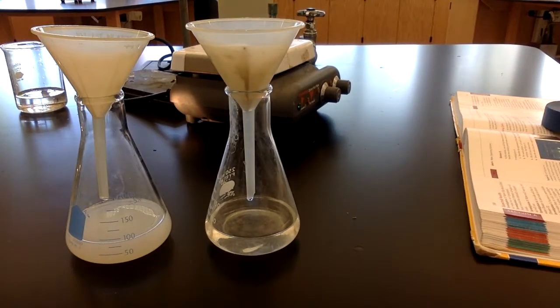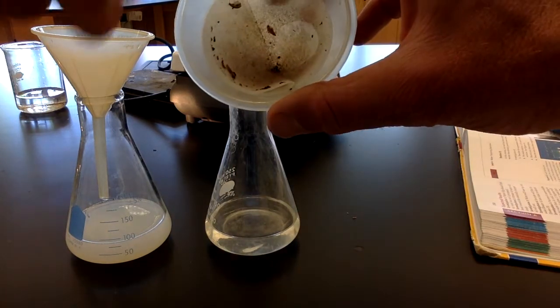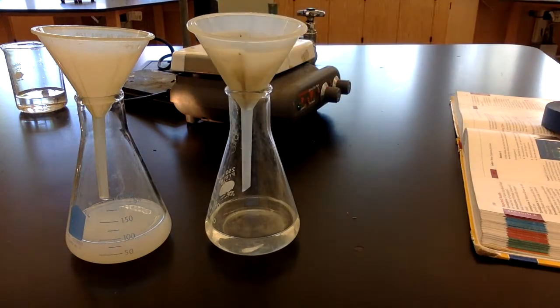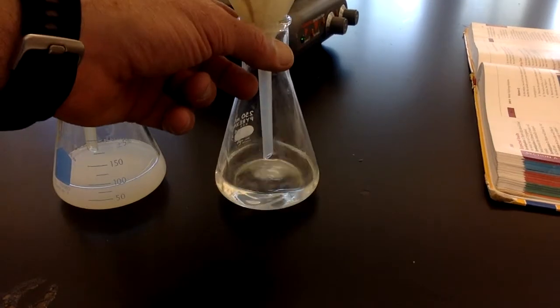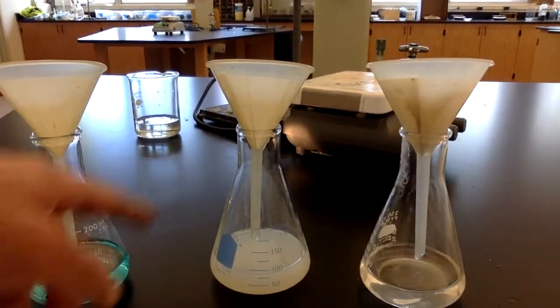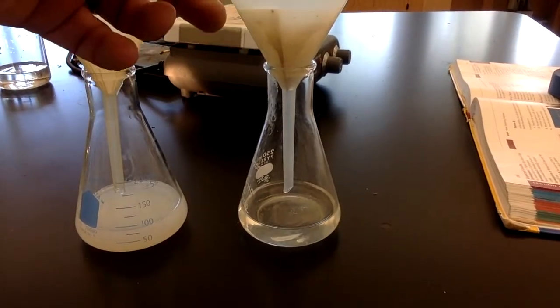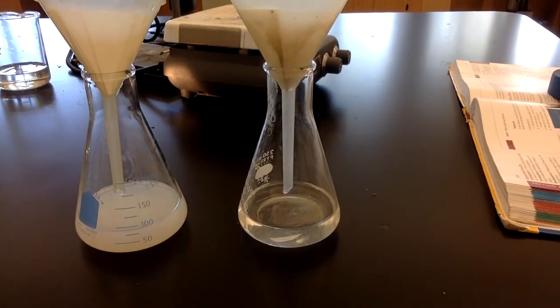And then in the third beaker, beaker C, the brown one, we can see that a lot of particles were caught by the filter paper, and we can see that the liquid that passed through it is clear, so there's no brown color to it anymore. So A, the blue color still passed through, in B, the white color passed through, but in C, that brown color did not pass through, and the filter paper actually took out all of the color from that.